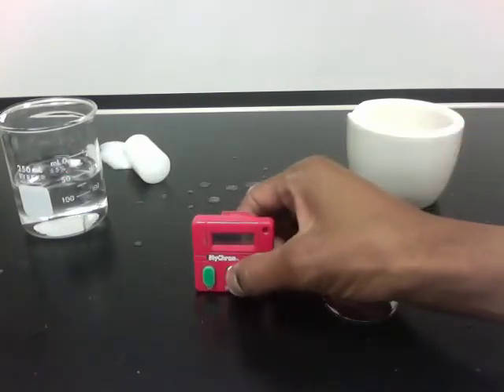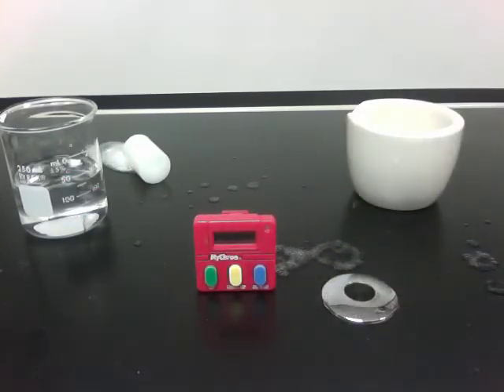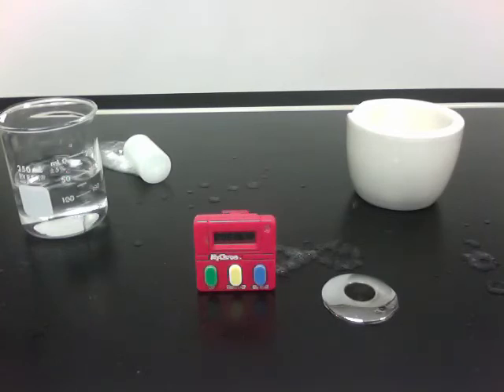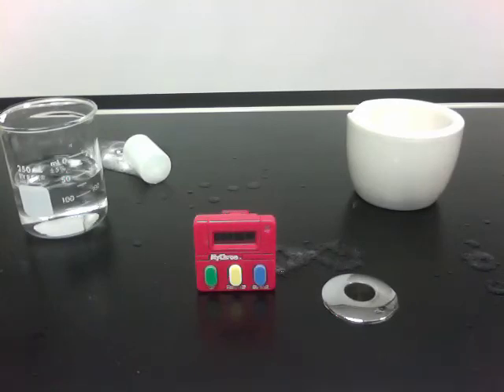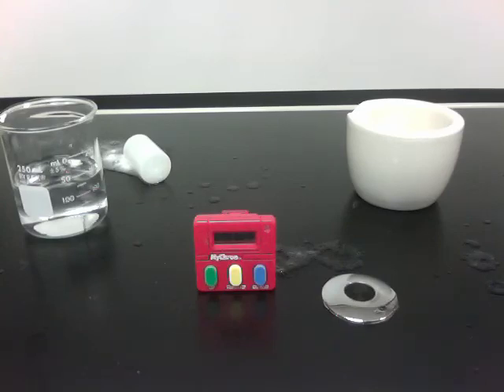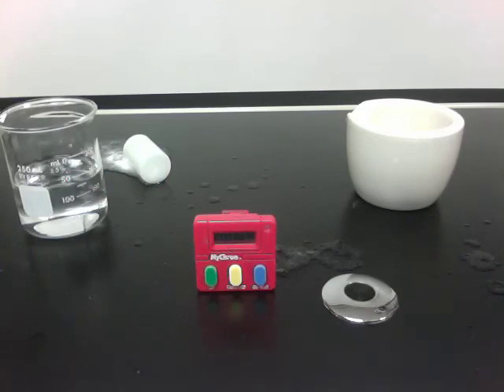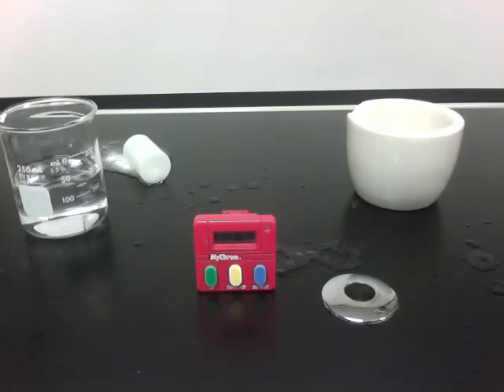And that was about six seconds. As you can see, the reaction took place at a faster rate when the tablet was crushed — the surface area was increased. Use this information to complete your lab sheet. You're being asked about variables, to summarize the results, and to give two real-life applications. Good luck.